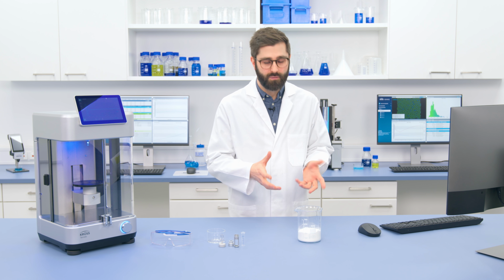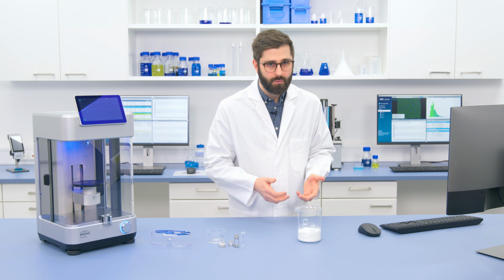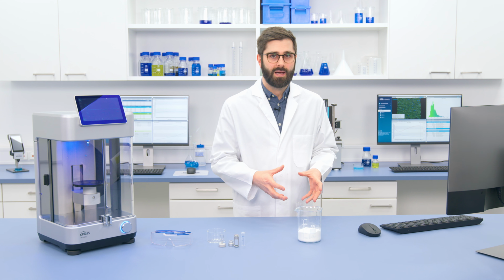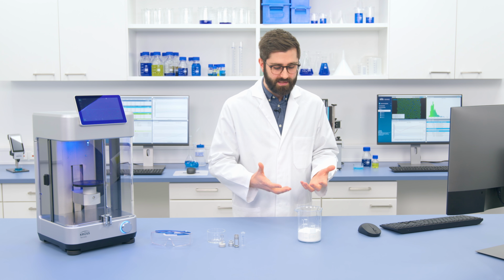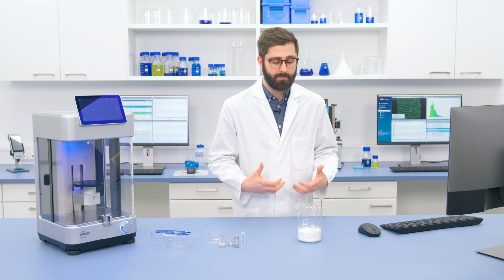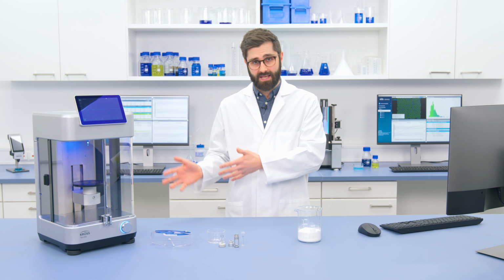Today we have a sample of cellulose powder. Cellulose, in particular microcrystalline cellulose, is a component of many applications. And for example, it's often used in the pharmaceutical industry. Now here it's really important to understand the wettability, because the cellulose is used as a filler in tablets. So we need to understand how it is going to disperse in the body, and for that we want to measure its wettability. So to do this, we can turn over to Tensíío.